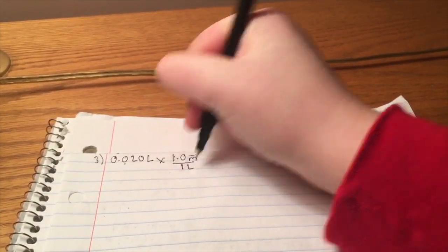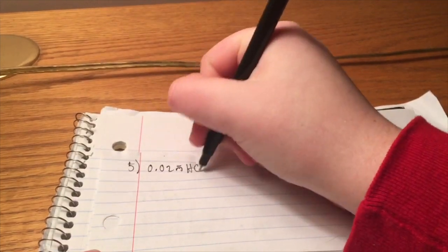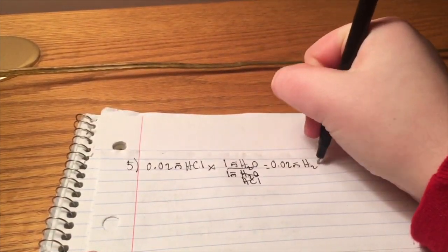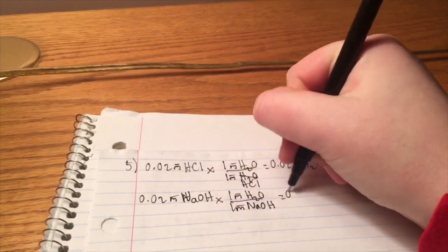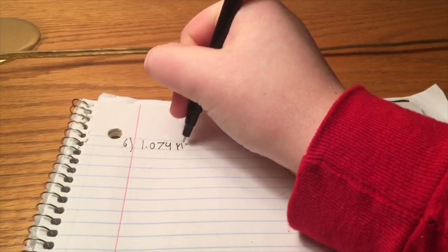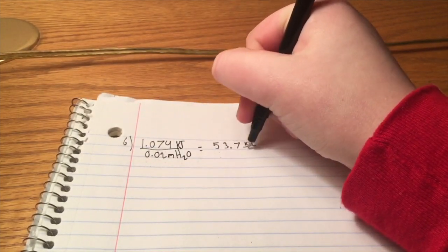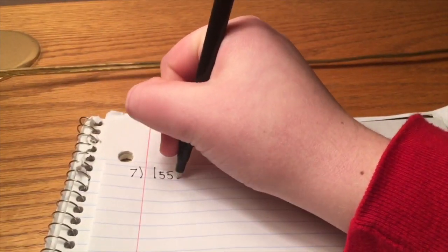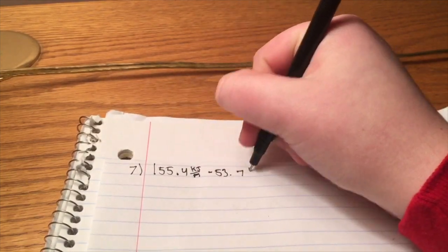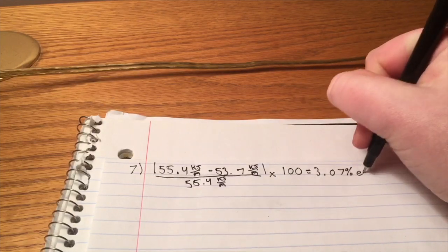Then the number of moles of hydrochloric acid and sodium hydroxide used in the experiment are found to determine the limiting reactant. The limiting reactant is then used to help calculate the number of kilojoules over moles of heat produced. With the limiting reactant and heat of experiment, we are able to find the heat produced using the unit of kilojoules over mole. Lastly, we calculate the percent error of the experimental heat produced based on the theoretical to determine how precise our experiment was.